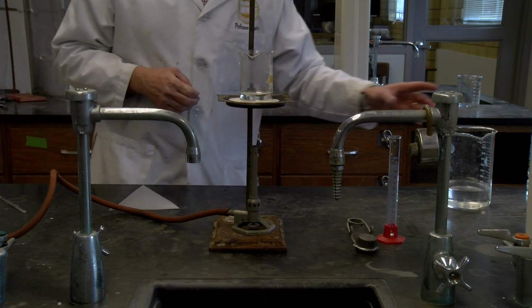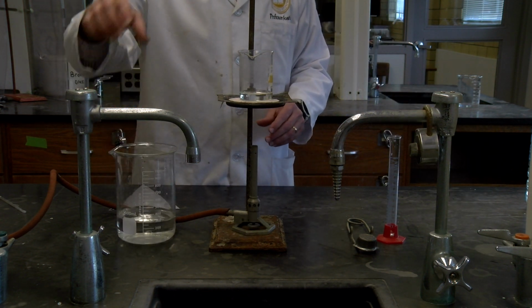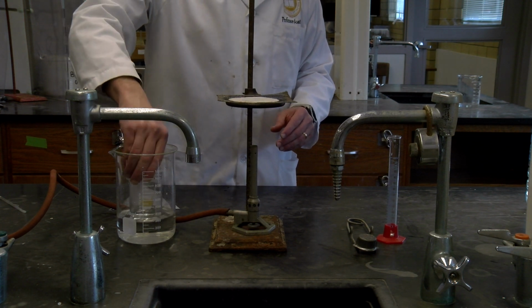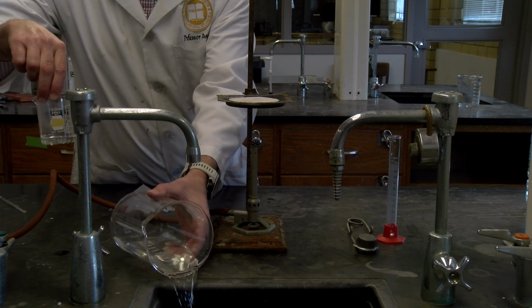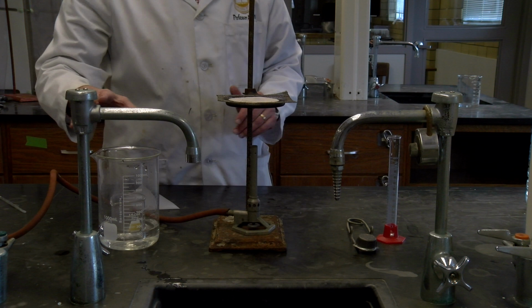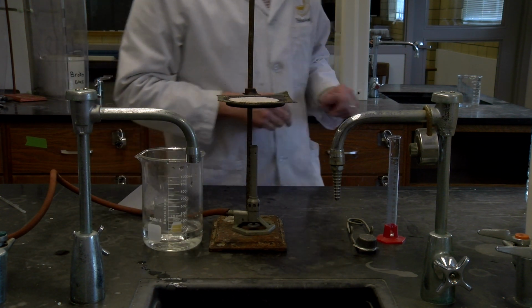So once it's completely dissolved, what we want to do is pour it into a beaker of water. So I just grabbed a large beaker of water and put some of this in there. So it looks like I got maybe just a little too much for this. I'm just going to put it in like this, and we're going to let that cool for a little bit.